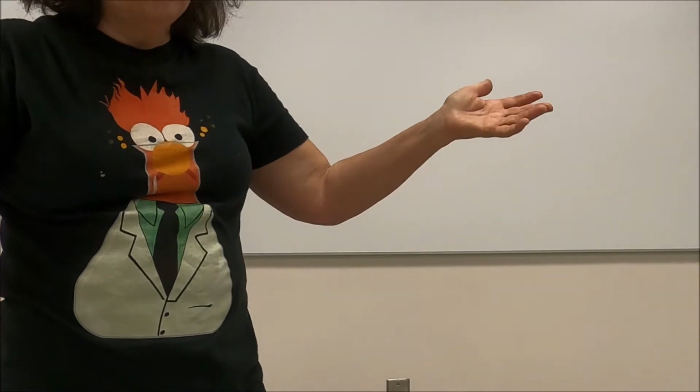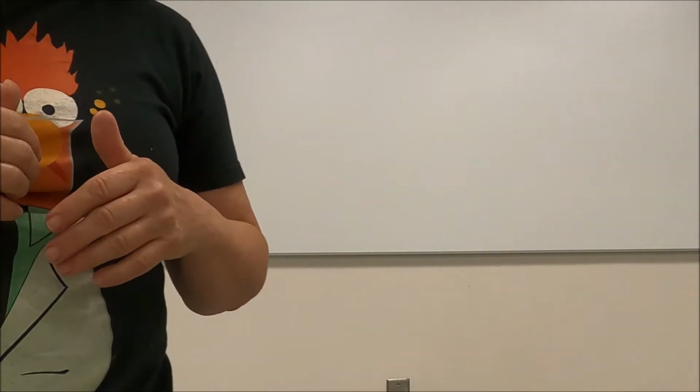Today we're doing an experiment. You're going to collect the data as we do the experiment, then work up the data and fill in your lab sheet, then scan it and email it back to me, or since it's just a Word file, you can type your information on your Word file and send it back to me. With this lab, you're going to be doing a graph, so I expect you to attach it to your lab. Learning graphing techniques and how to use graphs are going to be very important this semester.